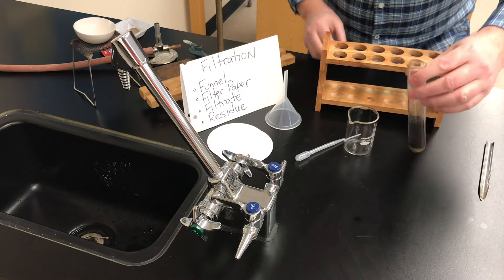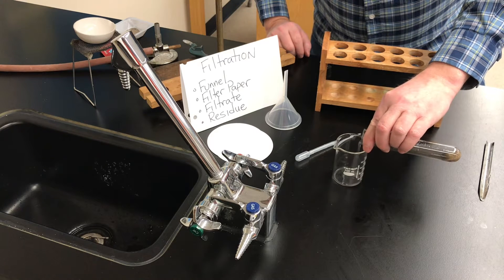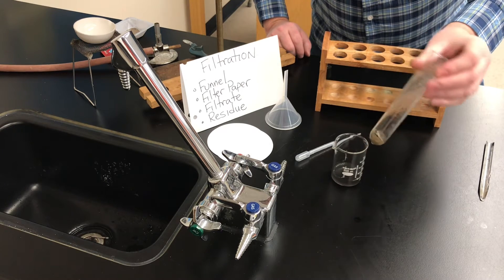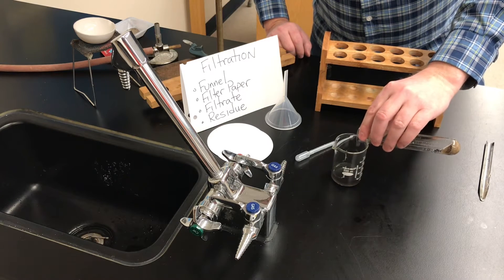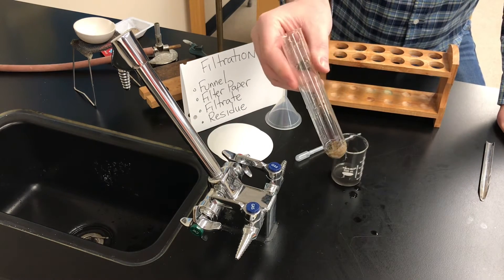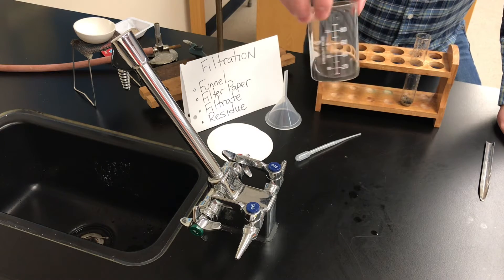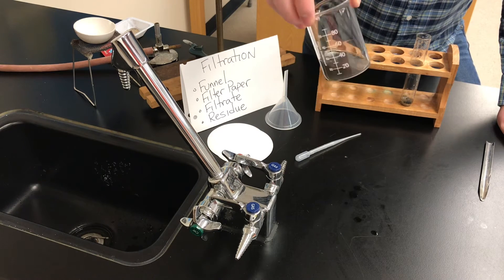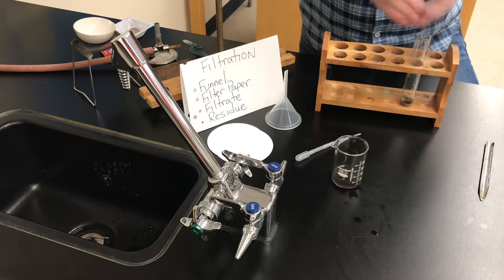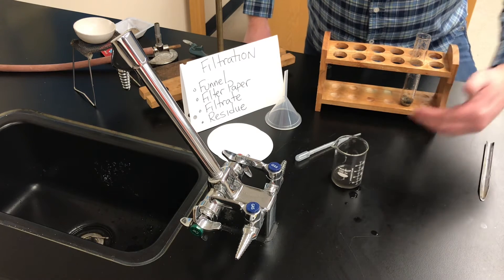I'll take the stopper off. I've got a beaker here. I'll use a technique we've used before — I'll decant — I'll pour the liquid out of the test tube and leave behind the sand, maybe with a little bit of water. At this point I've got mostly sand in the test tube — there's a bit of charcoal still in there — but mostly just sand. And here in my beaker I've got the dissolved salt and a significant amount of charcoal. We've managed to do some separating: the salt is now in the beaker, the sand is in the test tube, with a bit of charcoal in both.